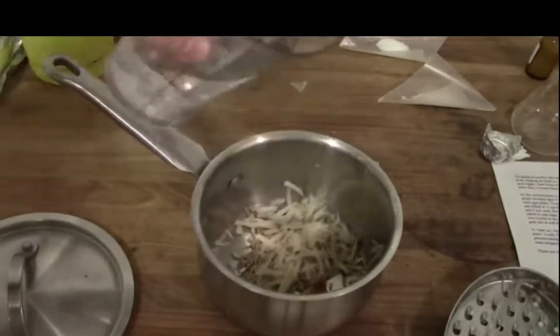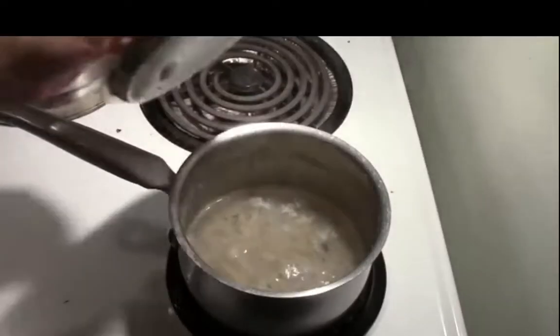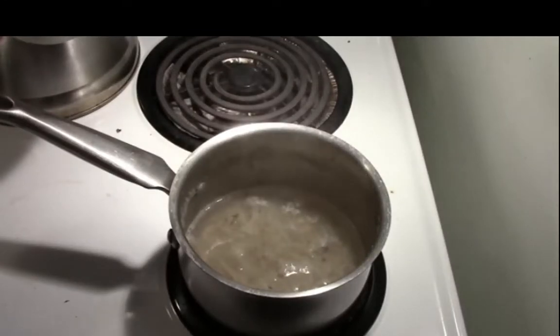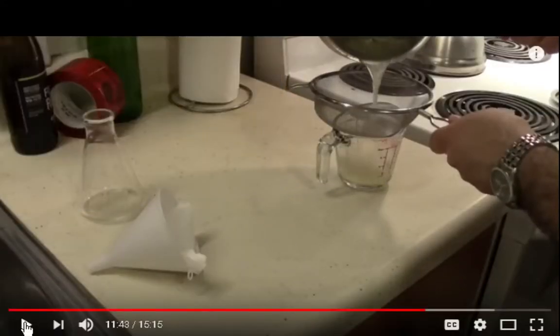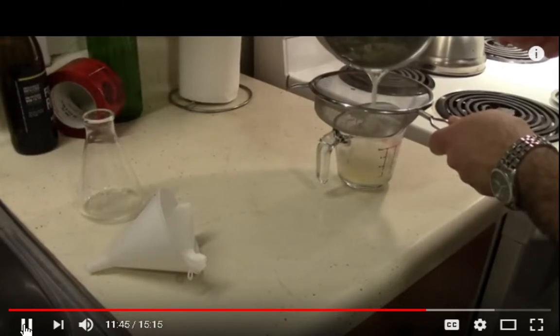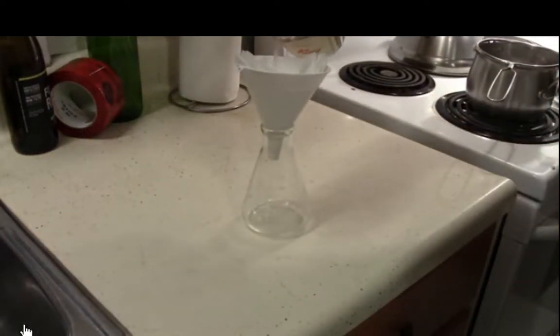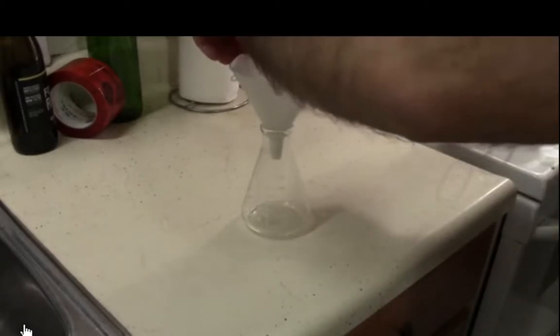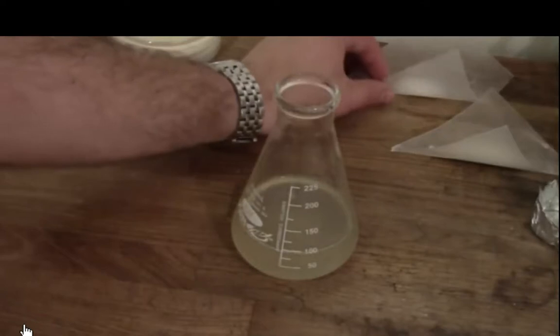We're then going to shred this, add a cup of water, bring it to a boil, and let that simmer for 20 to 30 minutes. At the end of that period, you want to filter this through. I'm using distilled water, and I'll have a fine mesh sieve. If you want to go a little bit farther, you can run this through a coffee filter after. The first filter should be through something a little more coarse so it doesn't gum up.